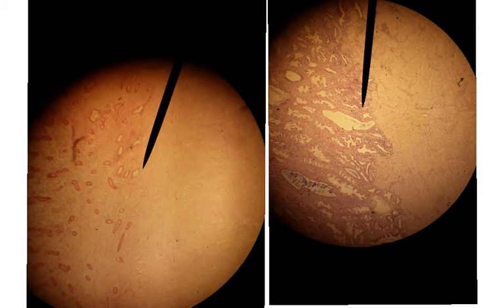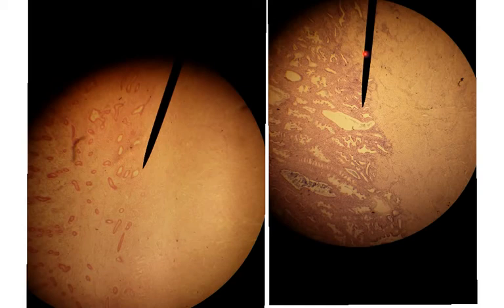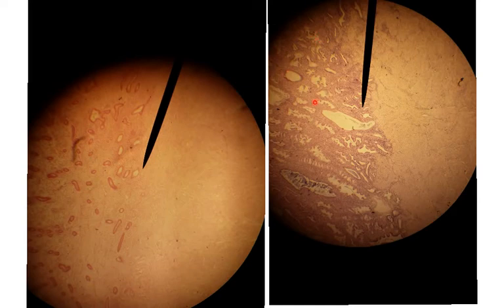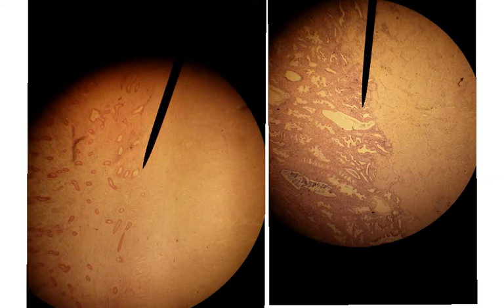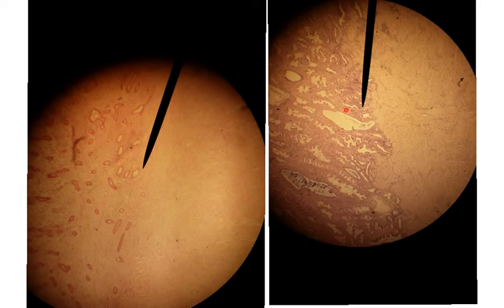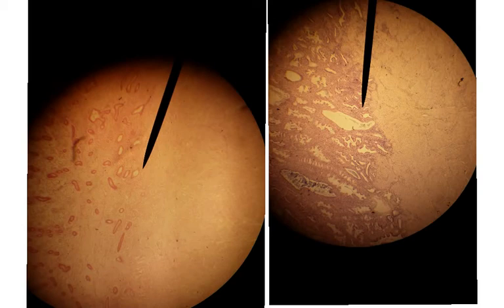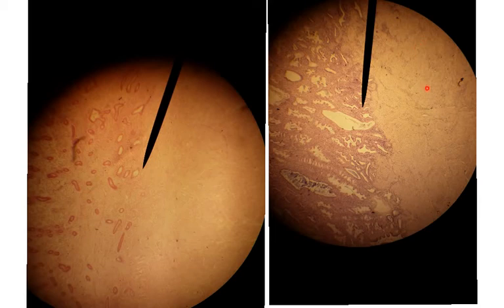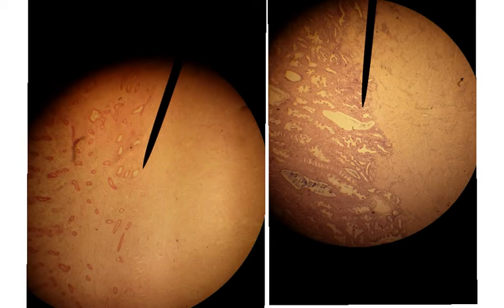Comparing that to the secretory phase on the right slide, here we see the uterine glands are much bigger and have a jagged edge appearance. This is still the endometrium, since that's where the uterine glands are, but this is much later in the cycle. Again, we have the myometrium that does not have uterine glands.